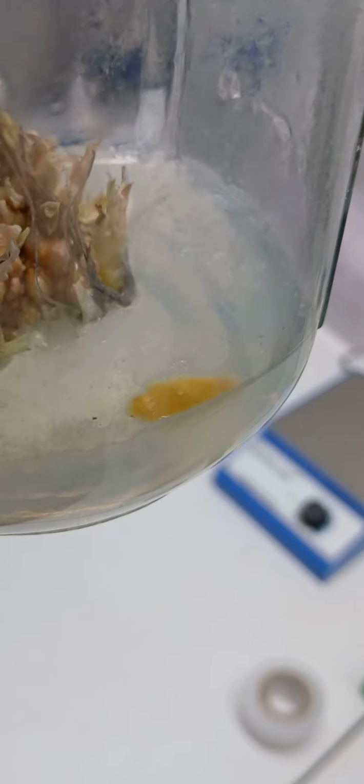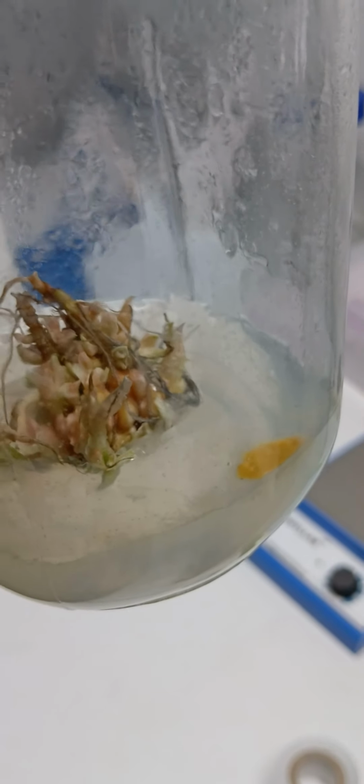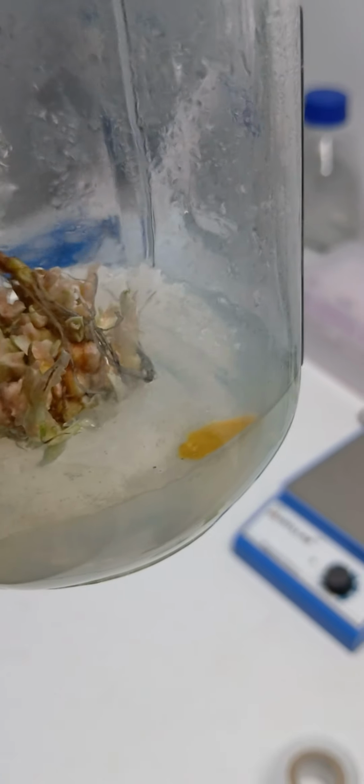In this jar, you'll see a mass of orange right here at the edge of the container. There's one here and there's one on the opposite side. Those are also bacterial contaminants. Now this is a media that I mixed up, so it could have been something that fell off my beard, fell off of my skin as I transferred this piece of plantlet into the media.